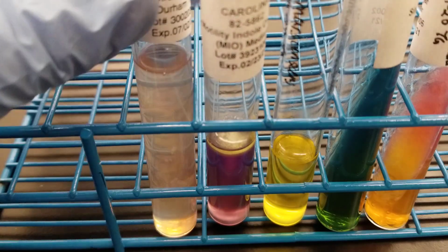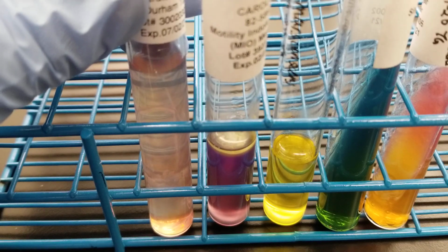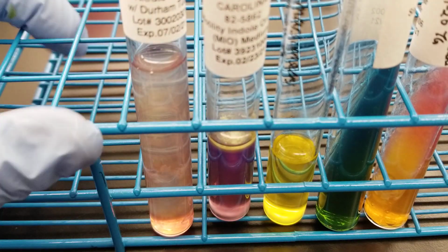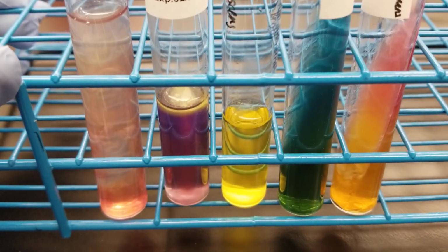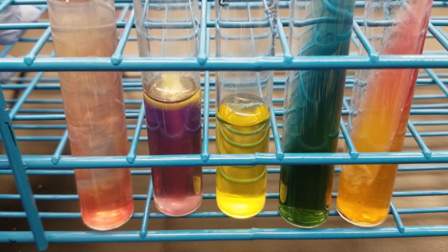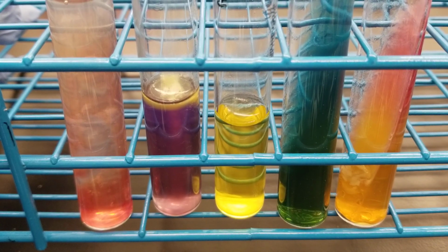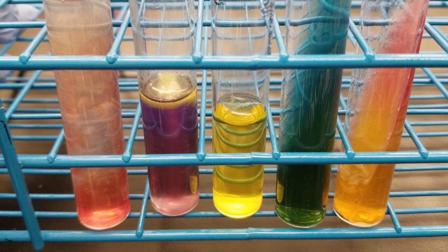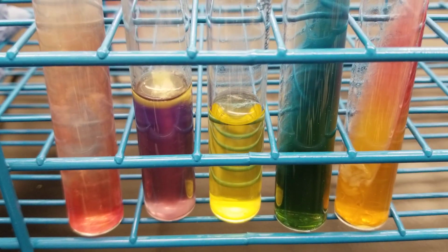It looks like it's already starting. There we are. Okay, so we're not even really needing to wait at all for those 3 minutes. This is a beautiful color change, which is expected. So again, this is Serratia marcescens, and everything is characteristic of the results that you should be seeing there.